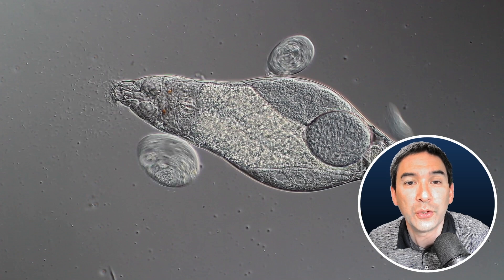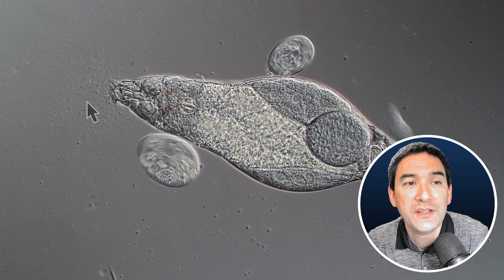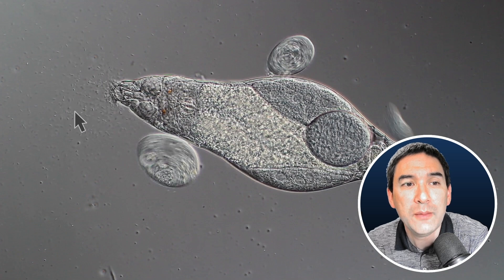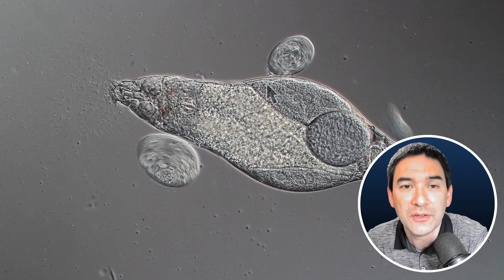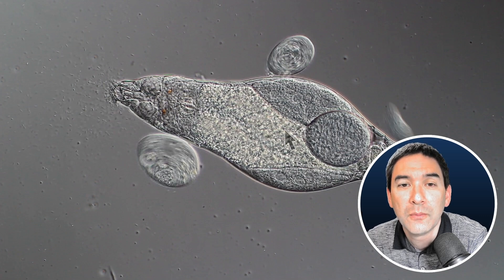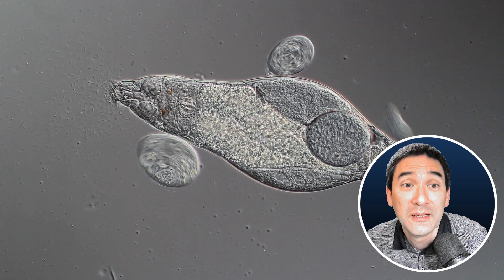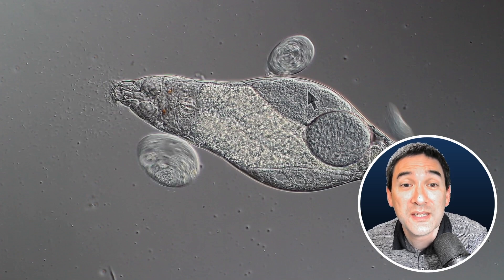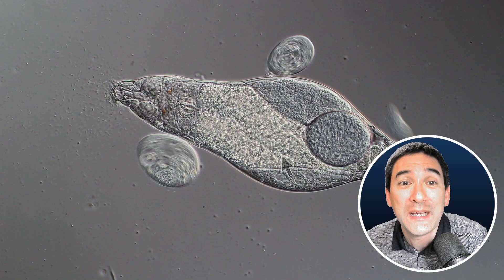I would also like to show you something quite interesting over here. If you look at the head of the rotifer, you're going to see those tiny little dots floating around — these are bacteria. The cilia over here on the outside generate a stream of water so that the bacteria are being taken in and eaten up. And then inside here there's the digestive system. This round oval structure over here is an egg. And over here on the outside we have two protozoans, single-celled, and over here our multicellular rotifer, made of approximately 1,000 cells — the cells so close together that it's not possible to see them as separate entities.